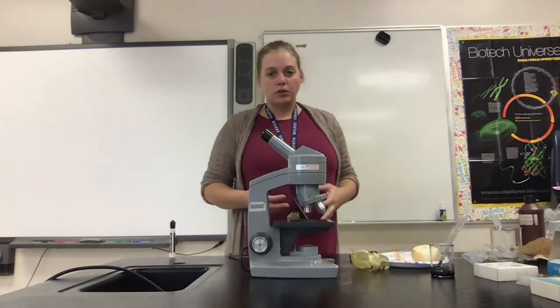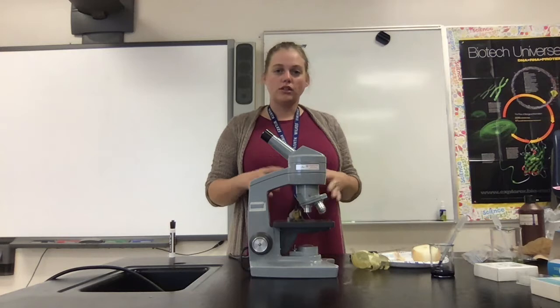Today, ladies and gentlemen, we're going to be learning how to use a microscope. So before we get started, let's go over some basic information about microscopes.